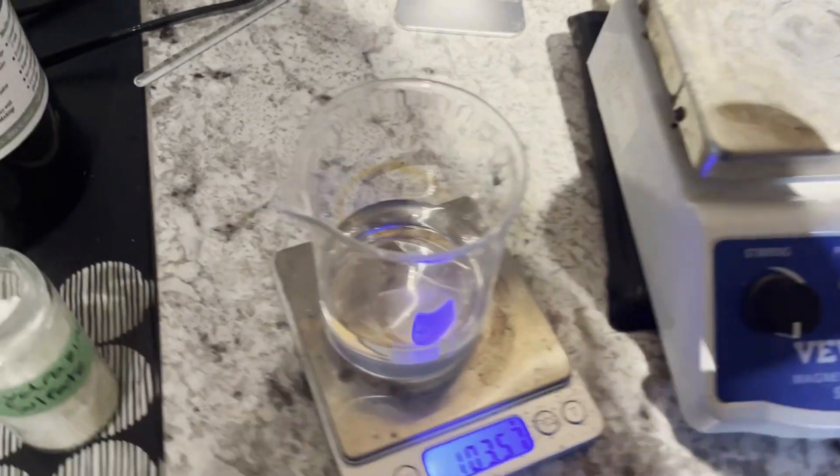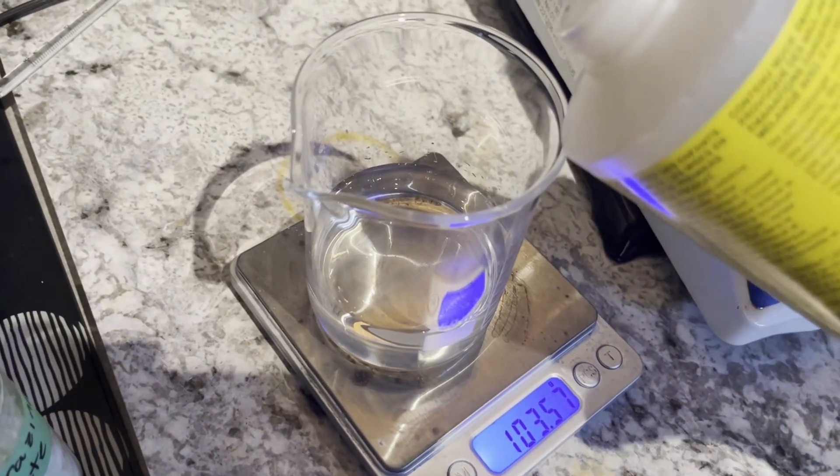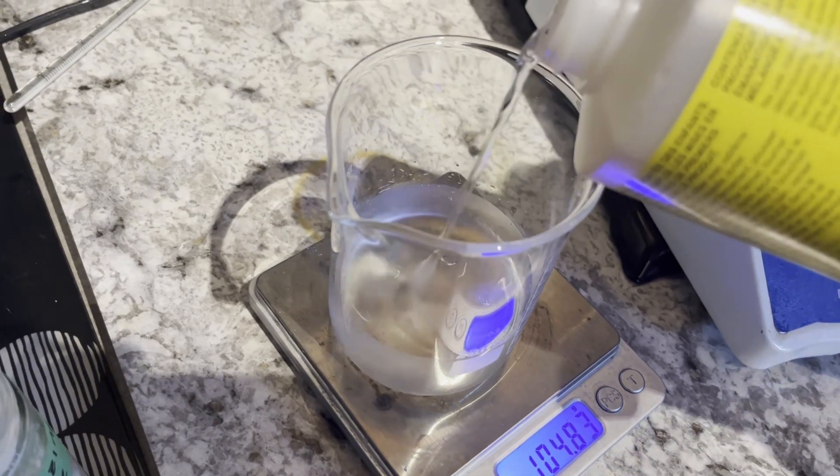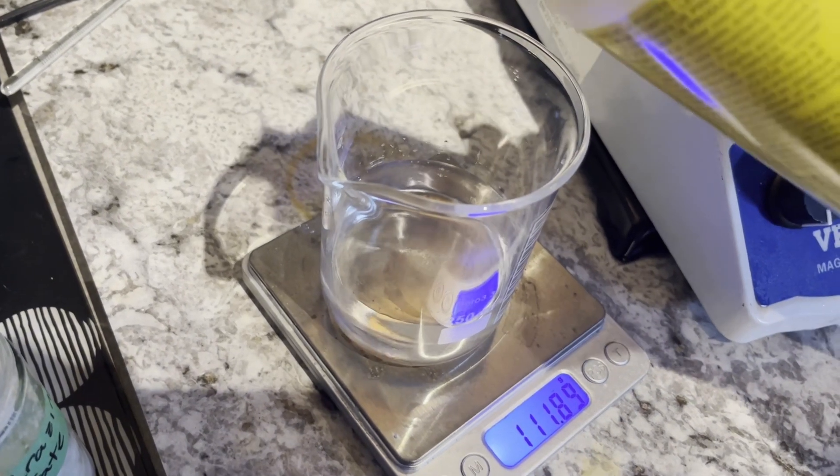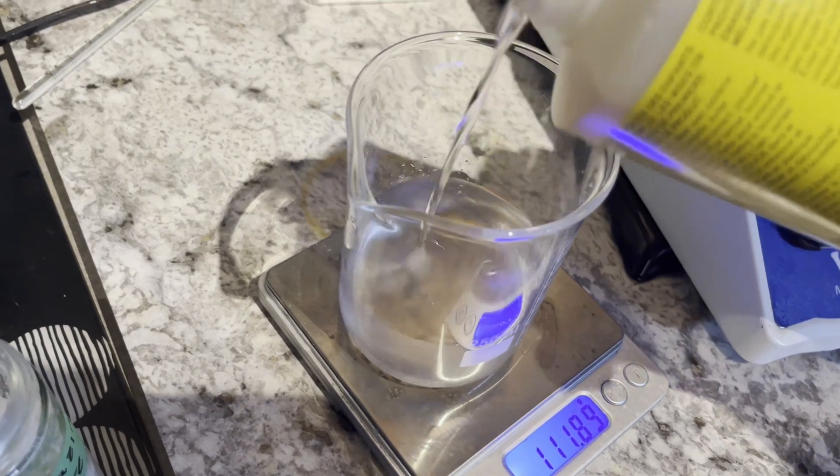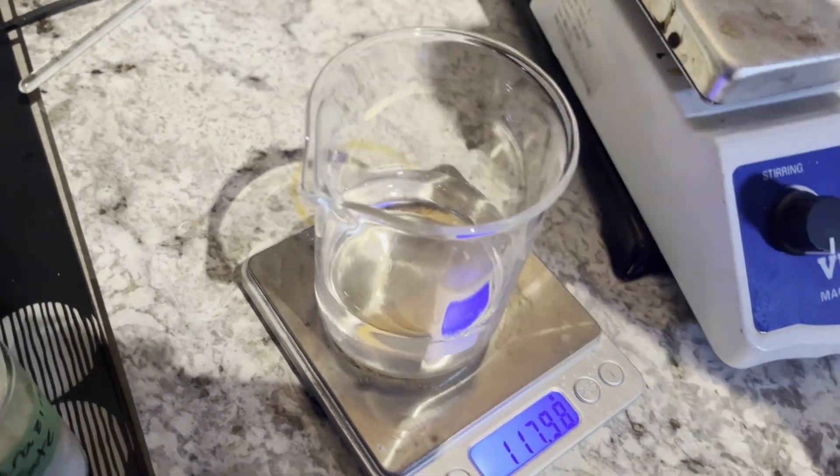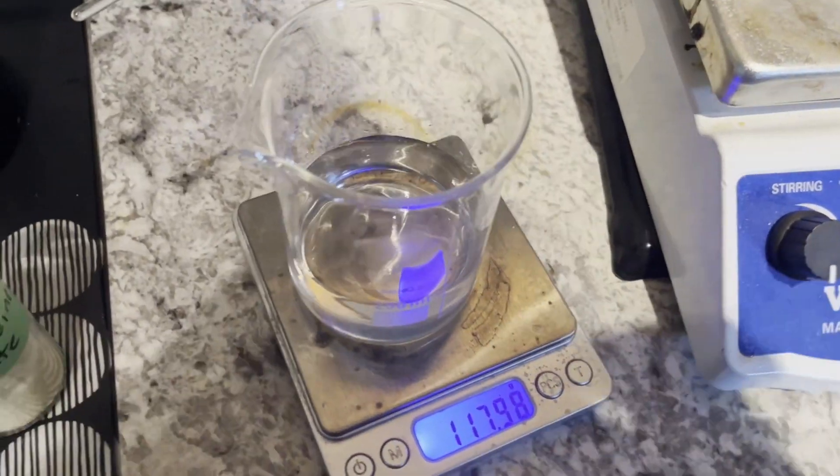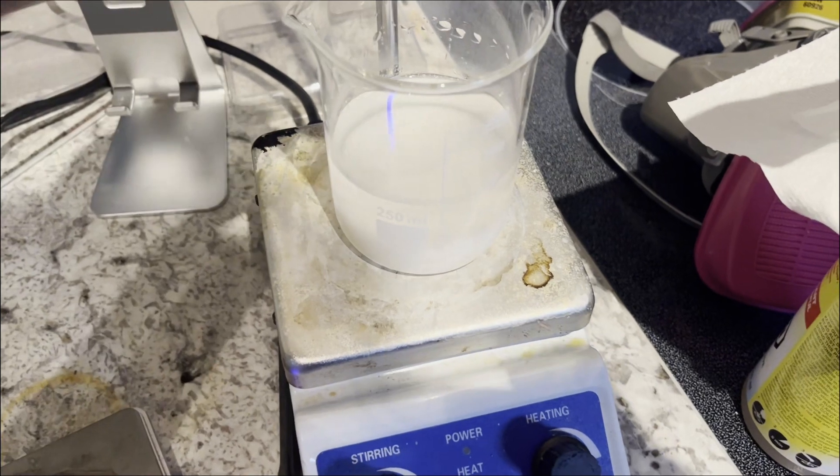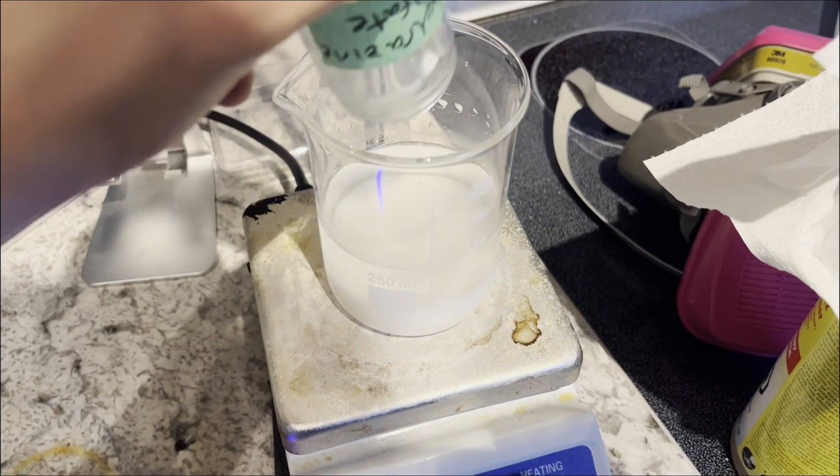To purify it, just make a 10% solution of sulfuric acid and distilled water, then add all of your sulfate in. Here I'm actually using clean sulfuric acid and not old drain cleaner. The reason you want to make the solution acidic with sulfuric acid is because it decreases the solubility of hydrazine sulfate.